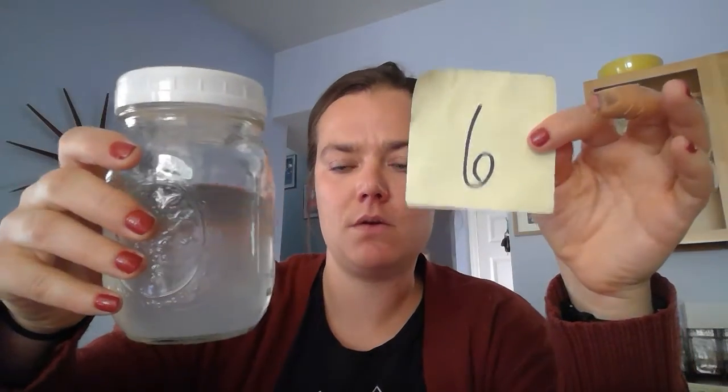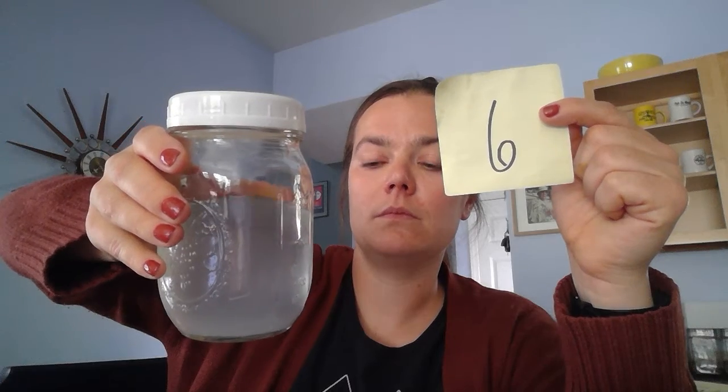All right, and then our last sample, this was a coconut hand sanitizer. I pumped a couple of pumps in there. Again, look at that turbidity. It is not clear. Like any sort of soap, something that we're washing our hands with all the time right now, and then that water is going down the drain, but it's not safe for us to consume. So how do we get that safely out of our water so that we're not drinking that and becoming ill? I'm starting to think about how we might get this alcohol-based sanitizer out of our water.